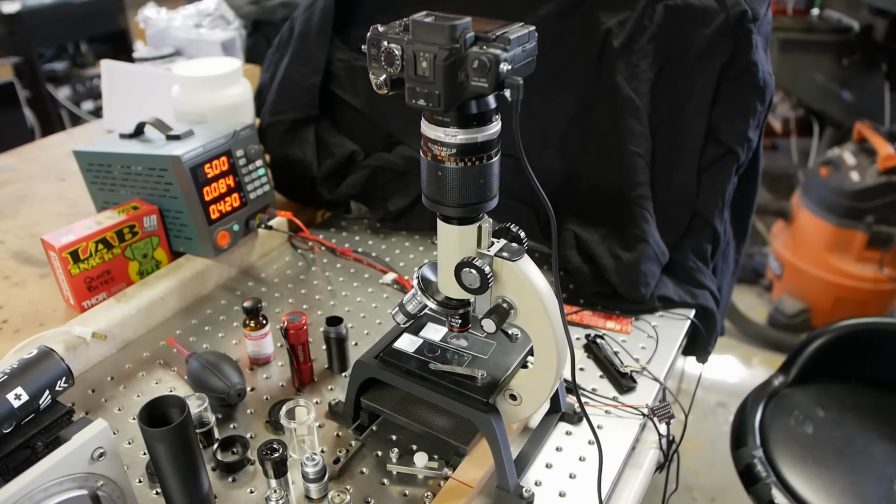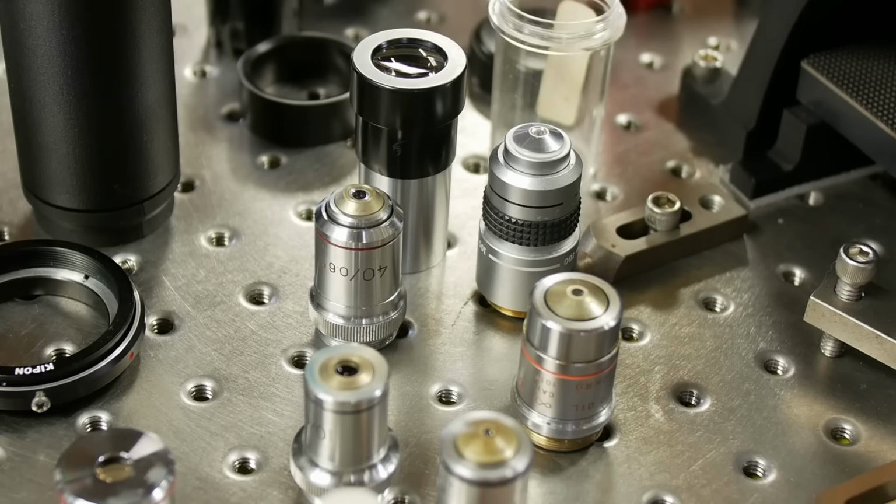When I was initially putting together YouTube video ideas about this whole technique, one of the hooks in my mind was, turn a cheap microscope into a really expensive microscope with this one weird trick. But as it turns out, that's actually not accurate because you need a very high quality imaging system to make this technique work. Since we're extracting so much information from the images to come up with this resolution boost, if you use cheap optics that have a lot of aberrations, this doesn't work at all. You actually need pretty high quality optics.